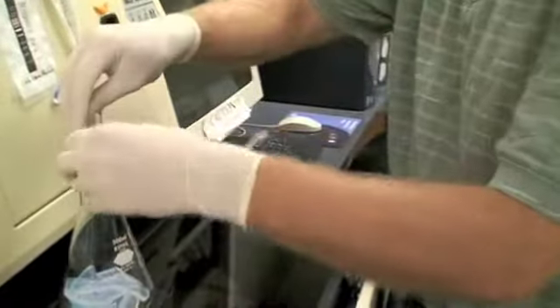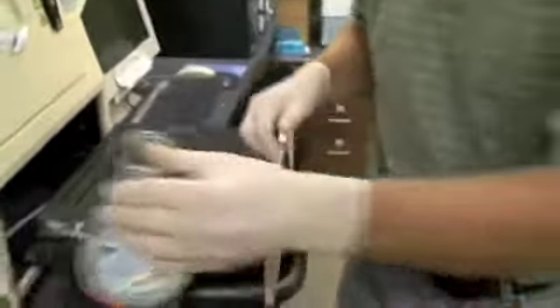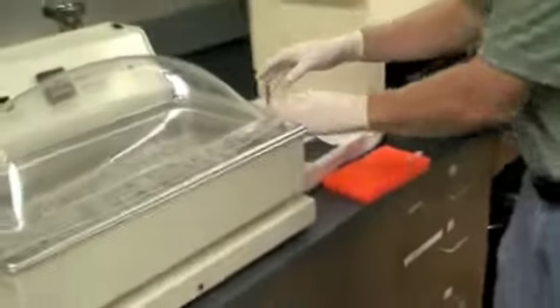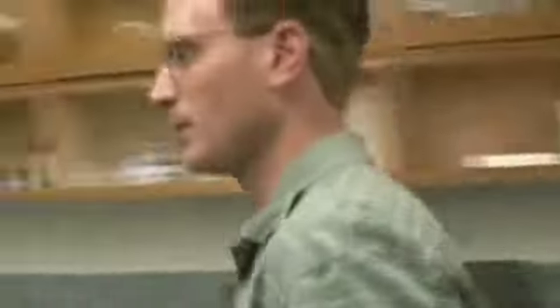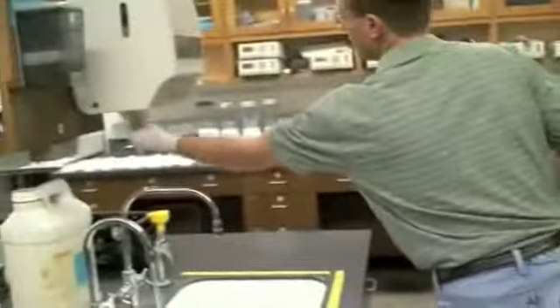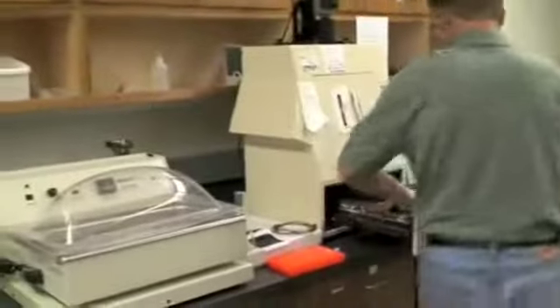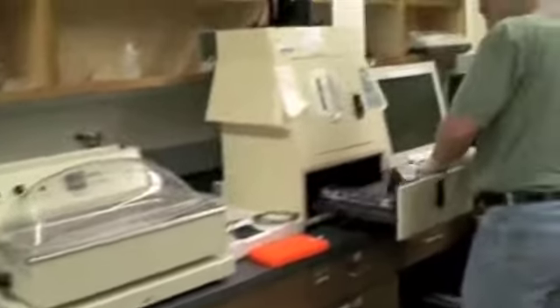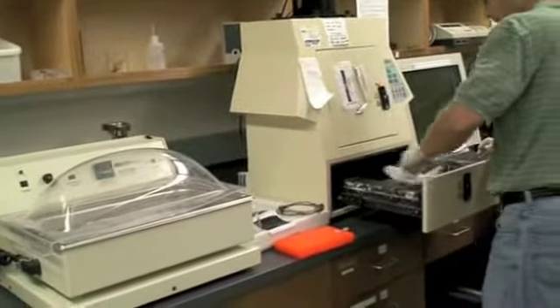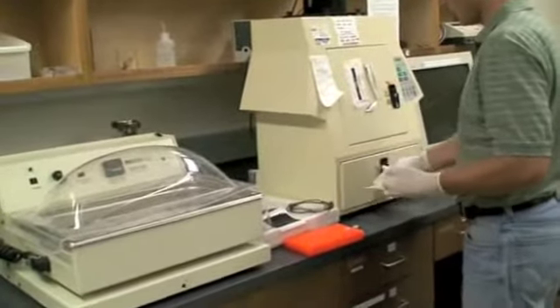So now we have our gel in there. Let's grab the towel again, not to leave it wet and leave salt on here. Or pieces of gel drying on there that shouldn't be.